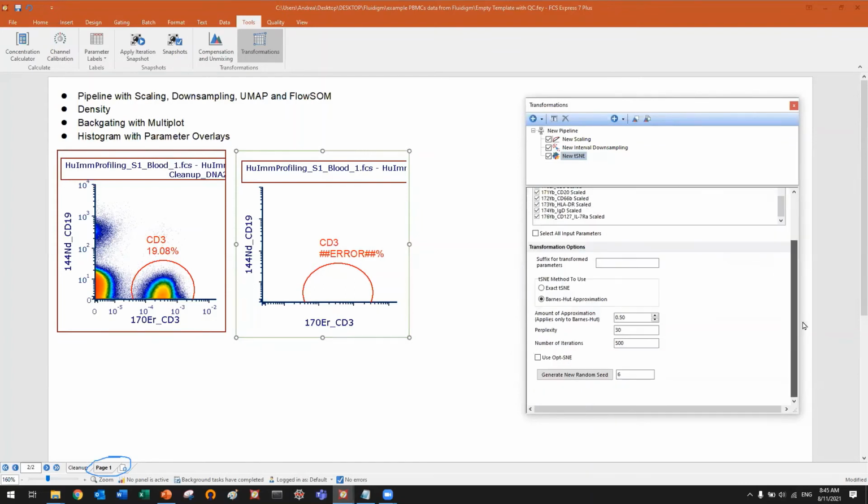And it's worth mentioning that you have all the control you want. You can run the exact t-SNE, but probably not a good idea. It's probably better the Barnes-Hut approximation, which is much faster. You can change the amount of approximation, the perplexity, the number of iterations. You can run an optimized t-SNE if you want. And if you don't want to run a specific step, you can uncheck it. Now t-SNE is there. I didn't delete it, but it's not running.